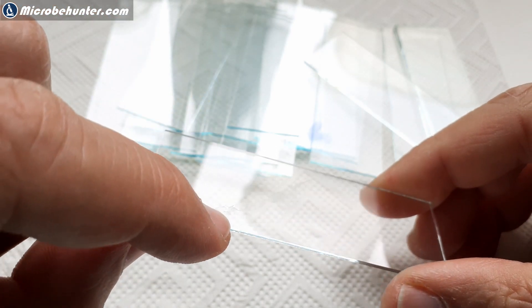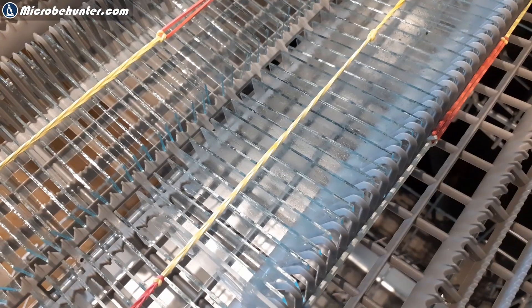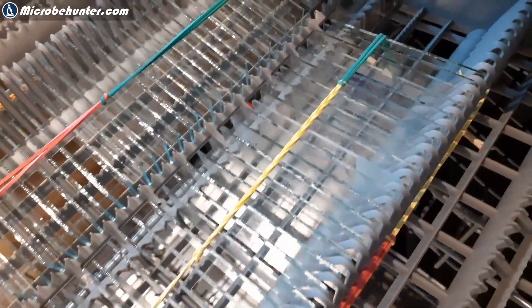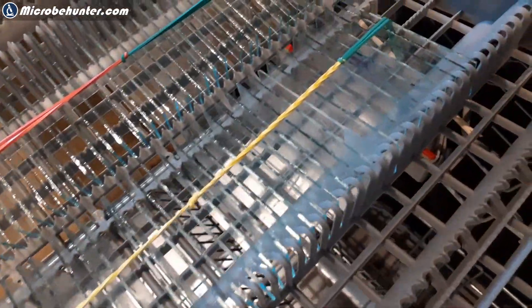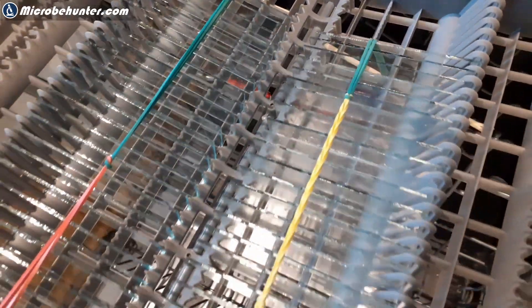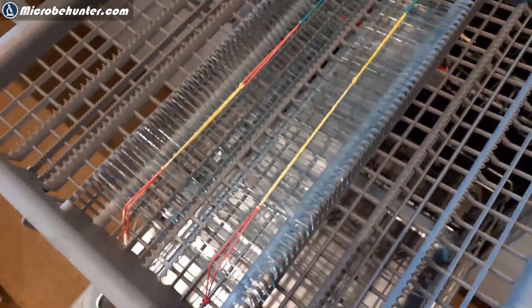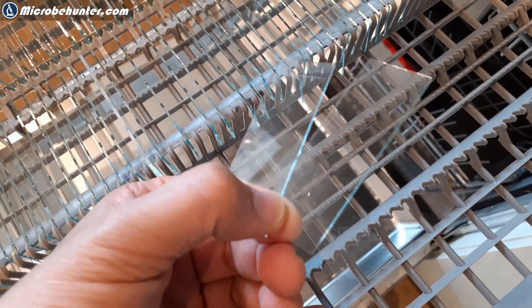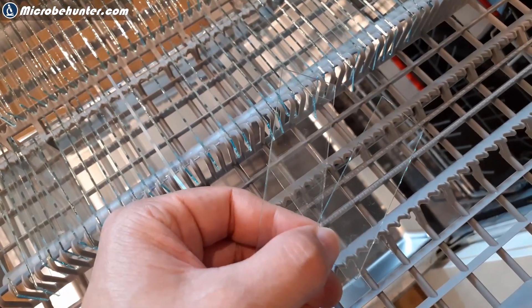The remaining residue could be because the slide tray was bent, so the slides touched each other, or the spacing was not large enough. For the remaining slides I decided to sort them directly into the dishwasher tray, and I also used rubber bands to hold everything in place. That saved a lot of time, and slides that were not sufficiently clean I simply gave an additional cleaning. But one has to be careful about dishwashing salt and detergent that might still remain on the slides.